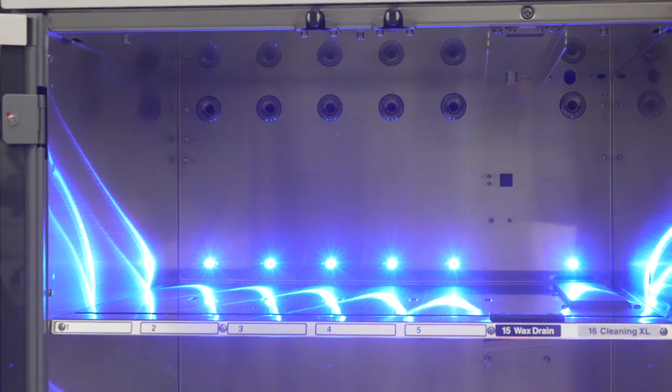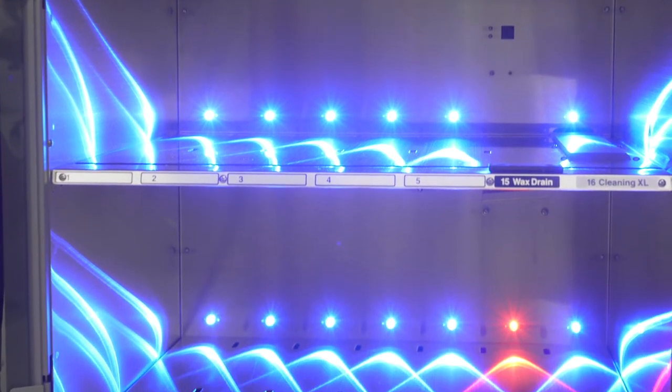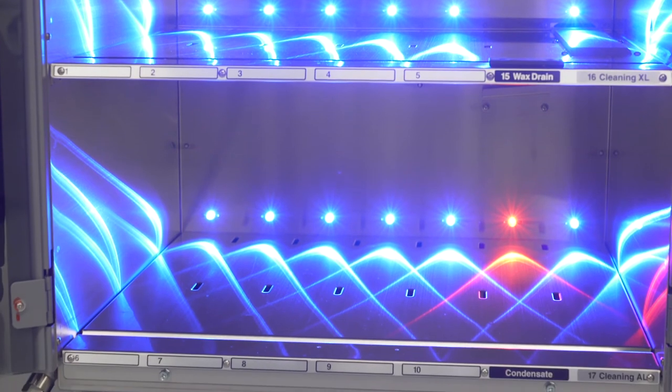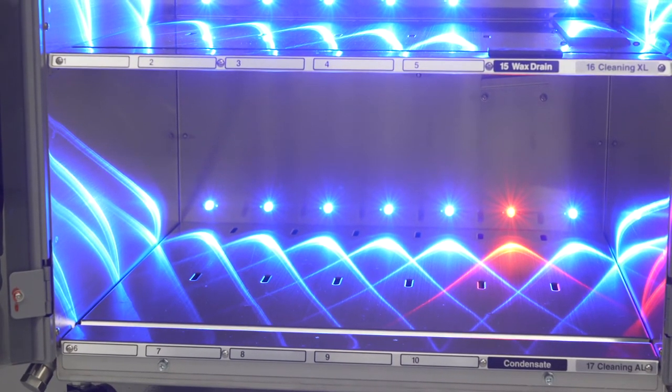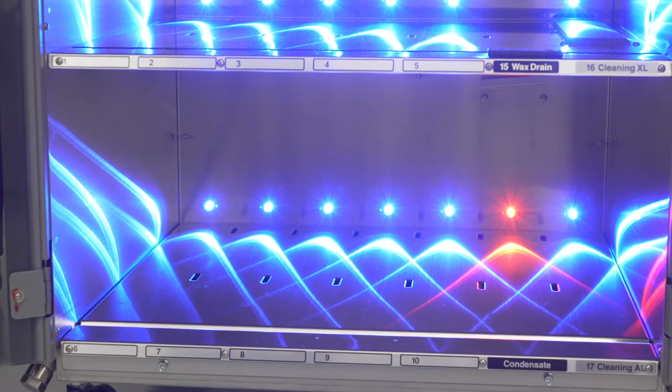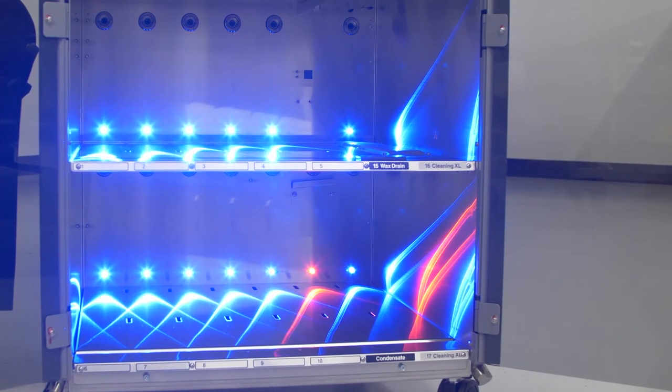In the back wall of the processor towards the bottom, you will see blue LED lights that the processor uses for you to visualize the reagent levels in the containers at the start and end of processing, as well as the start and end of the clean cycle.